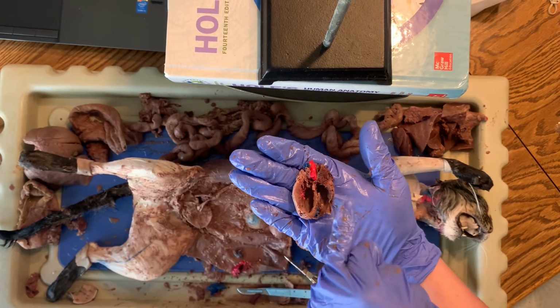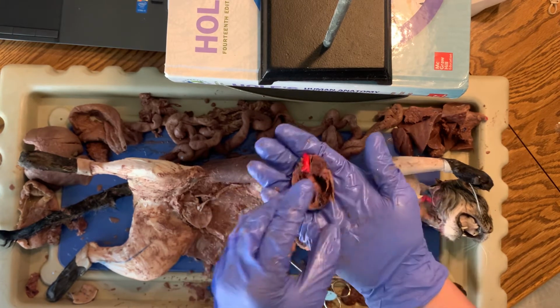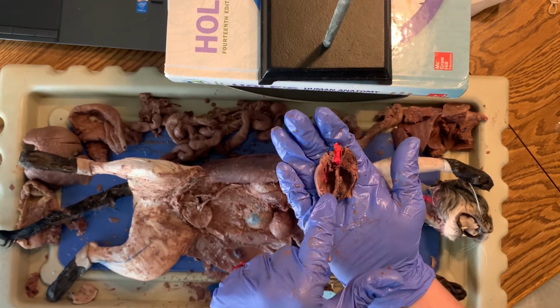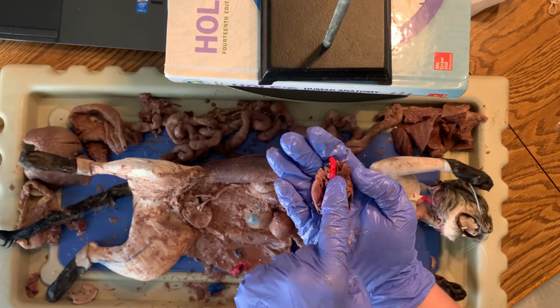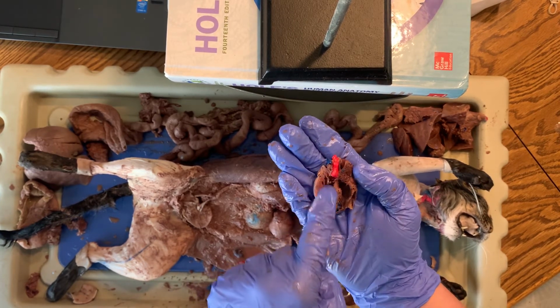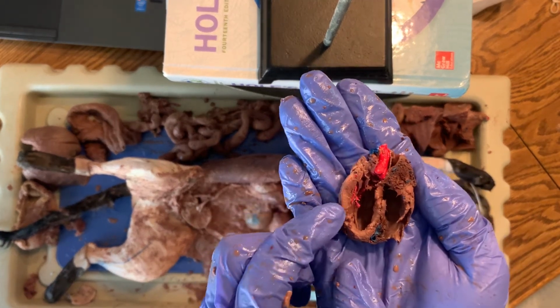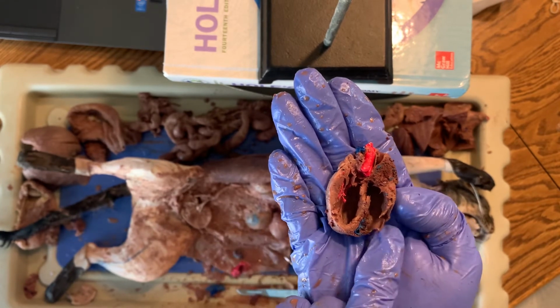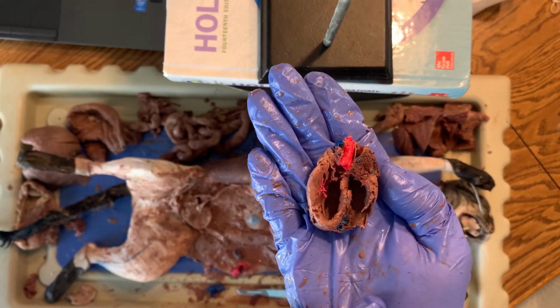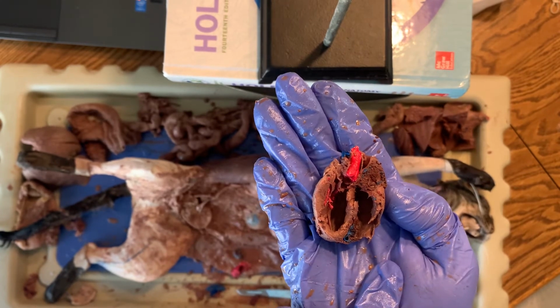So here is the left ventricle, right ventricle, left ventricle. The left side has to go to the entire rest of the body, out the aorta. That's why it's pink there. All oxygenated blood. Look how thick that wall is on the left side. It's got to go a long, long distance to the whole rest of the body. This wall almost ripped apart when I pulled that latex out because it only has to go to the lungs. So a very, very short distance.